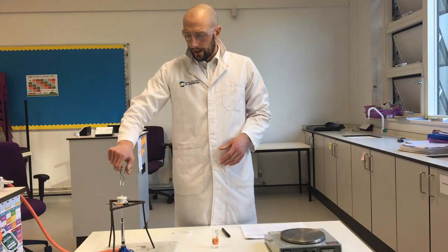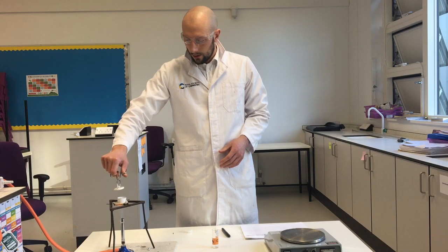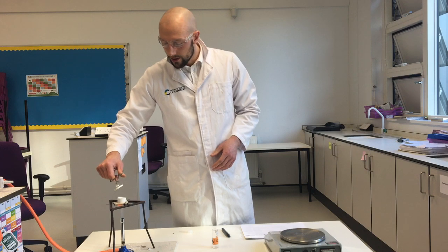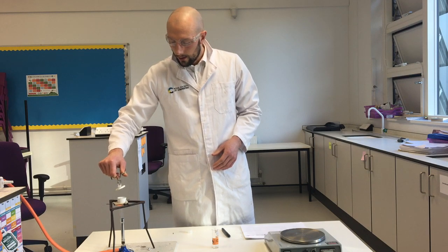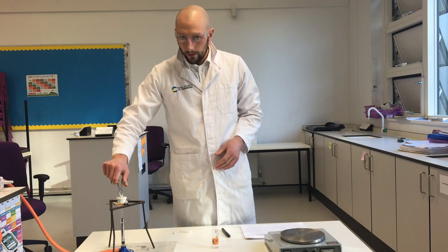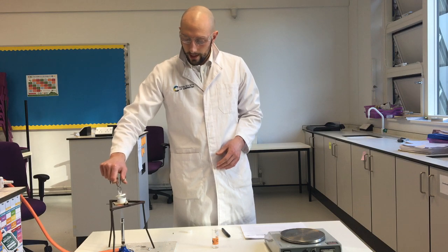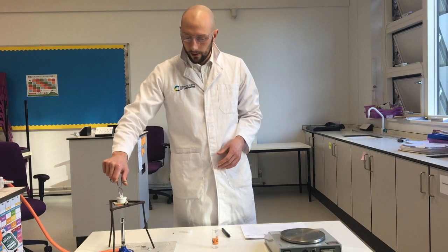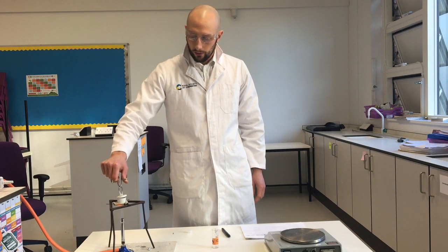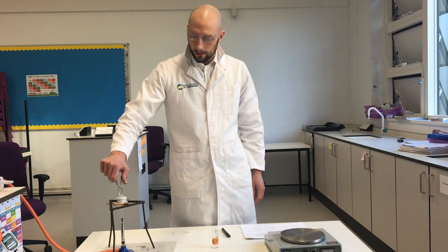This should be very hot now, so I'm going to check it, see if it will start reacting. Oh, I think it might be about to start. I can see it starting to burn in there. There we go. I don't want to let any get out, so when it starts burning, I'm going to put the lid on, and I'm going to do the same again. Let it start burning, put the lid on, because I want to get the oxygen in, but I don't want any of my compound to come out as it's burning. All of that smoke is my compound magnesium oxide escaping.